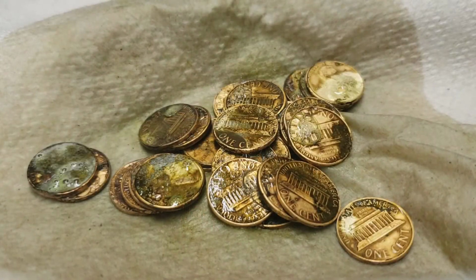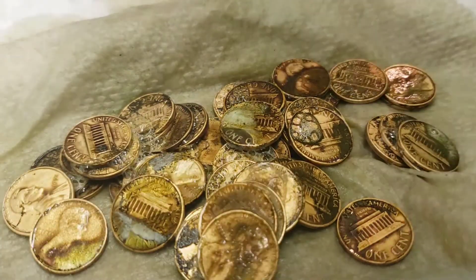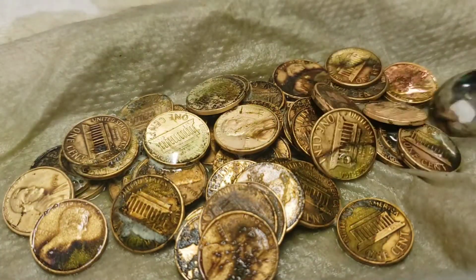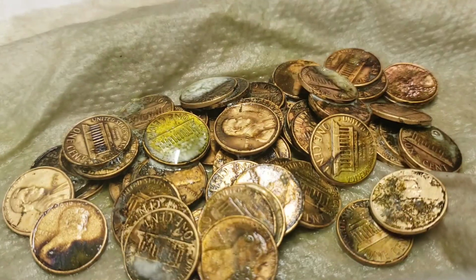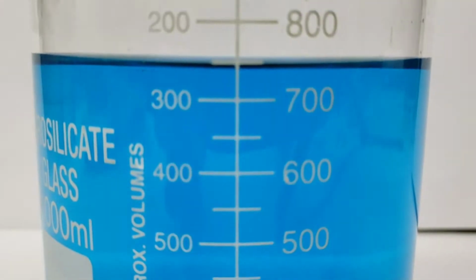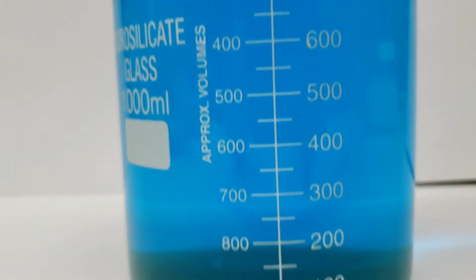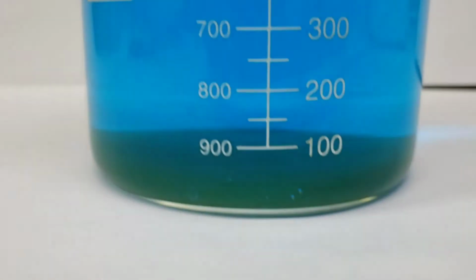One thing I noticed pretty quickly was, when I set down the first couple of pennies, they sort of got a little bit darker and changed a little bit as they dried out, so I set up the camera when I set down the other ones, and this is kind of what that looked like, which I think is kind of interesting. I don't exactly know what it is, but it's interesting, I think, anyway. And here's how the liquid has cleared up and gotten a little bit lighter blue after a minute or so, and how more of the greenish stuff has settled towards the bottom.